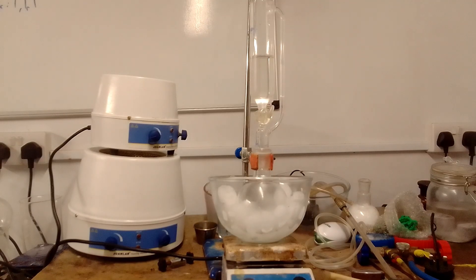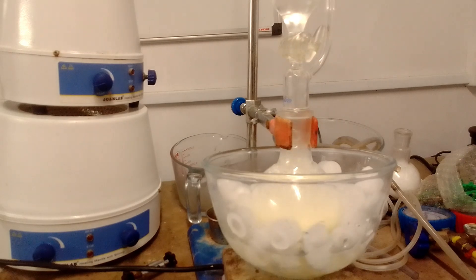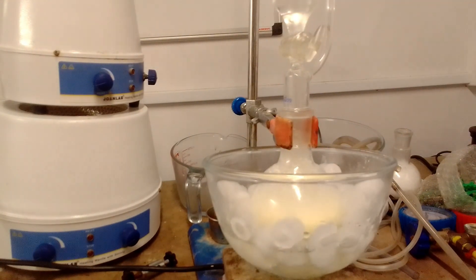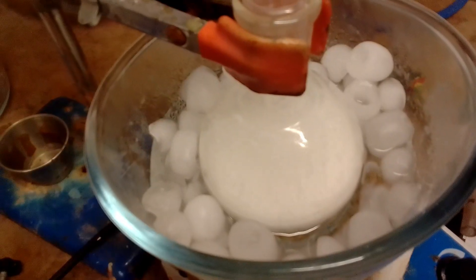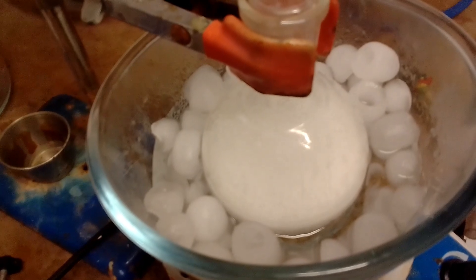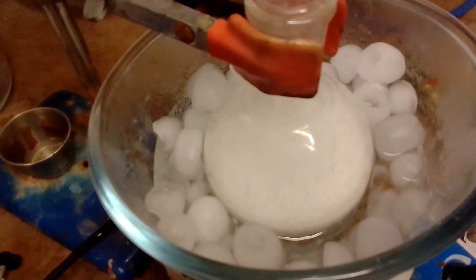There was some fizzing and foaming and quite a lot of precipitation but little heat was generated. The caustic soda solution was then added very cautiously because this is where things got interesting. As in the original procedure during the hypochlorite addition, a head of acrid white smoke soon developed above the mixture, most likely freebase monochloramine forming an aerosol with water vapour. This disappeared as addition continued, as did the yellow colour.